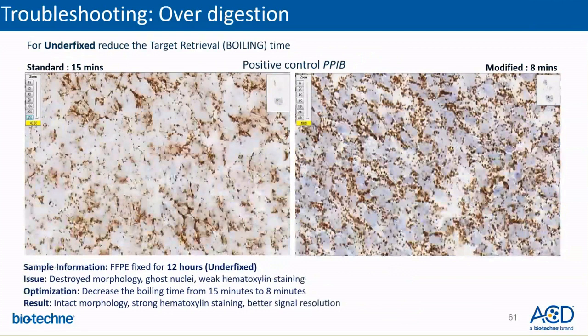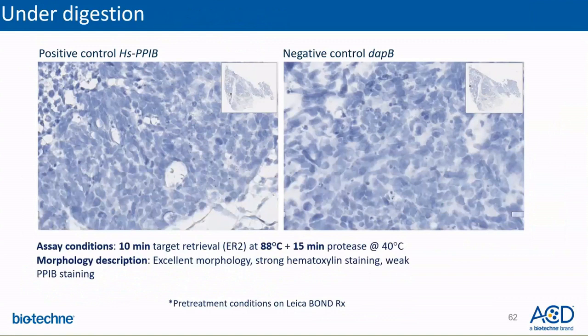Compared to the image on the left, you can see that there is better morphology and better signal resolution after using the modified target retrieval time. On the other hand, here are samples that are underdigested. The PPIB staining is much weaker, but the tissue morphology is intact.